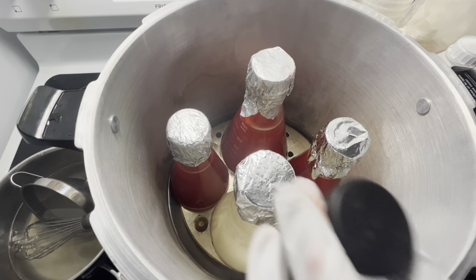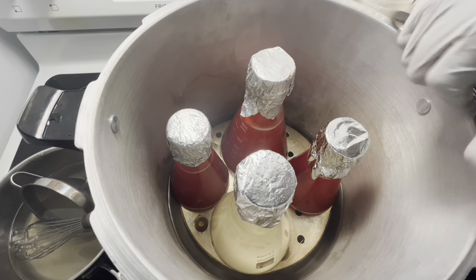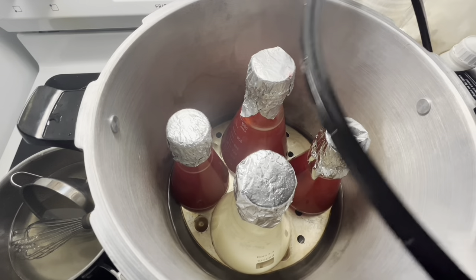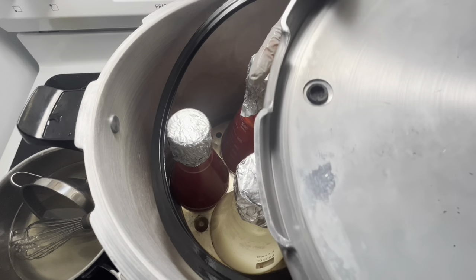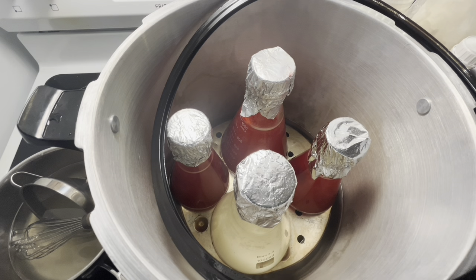Make sure you have your rocker before you get started. If you haven't used your pressure cooker in a while, take the ring out and wipe it down. I'm going to get some cooking oil — sunflower oil — and go around the ring to lubricate it. You don't want your ring to dry out. Then I inspect the pressure cooker lid: make sure the rocker is moving freely, and I look through the hole and blow through it too to make sure it's clear.